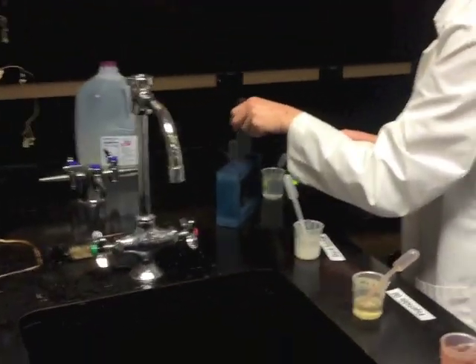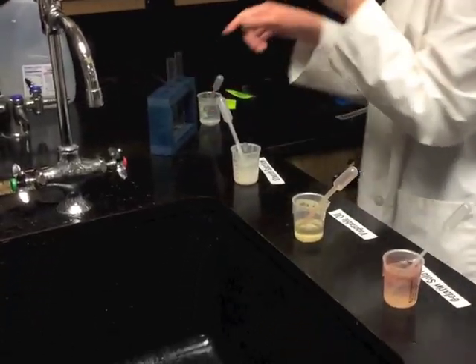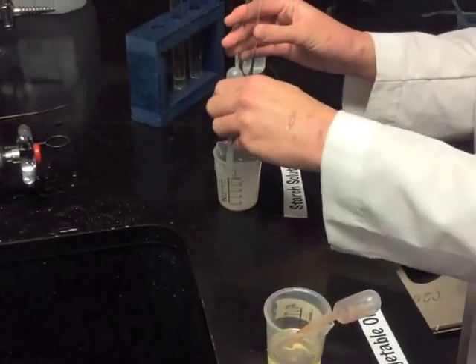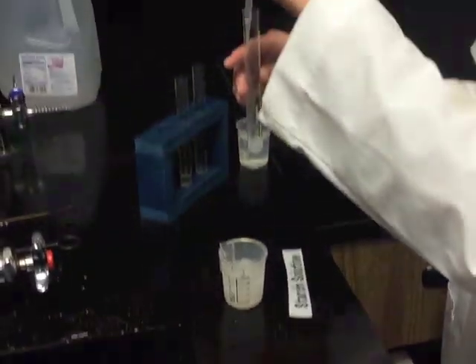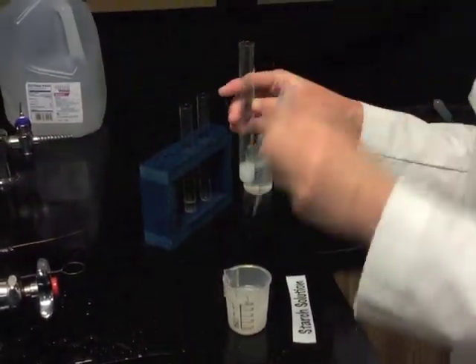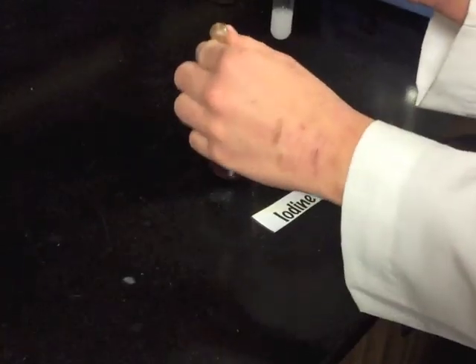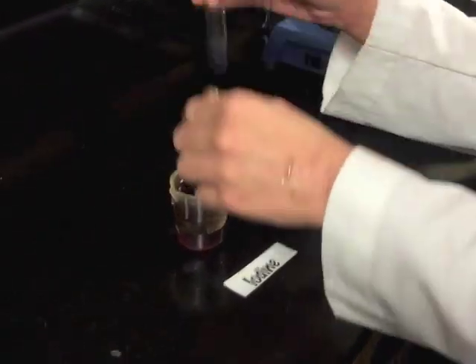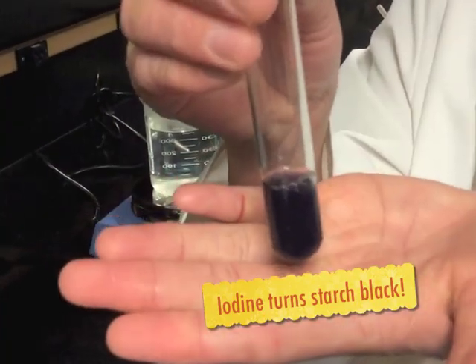The last test is the starch test. Put the starch solution in the tube, then add some iodine. It will turn black because starch is present.